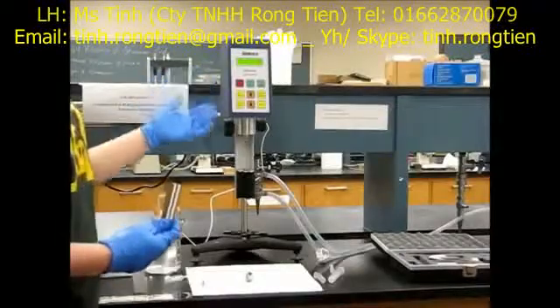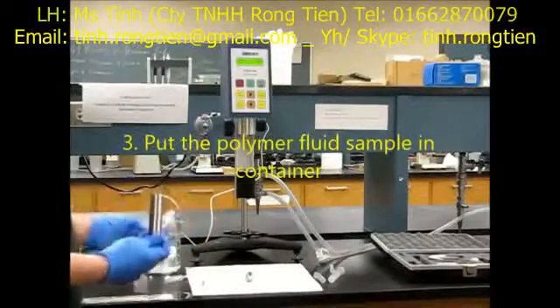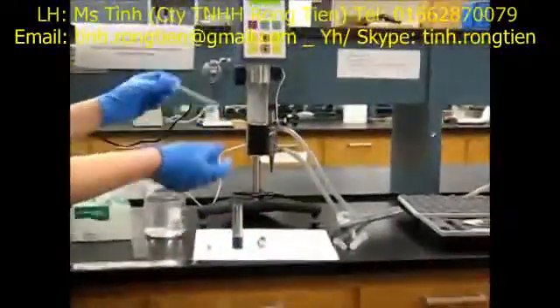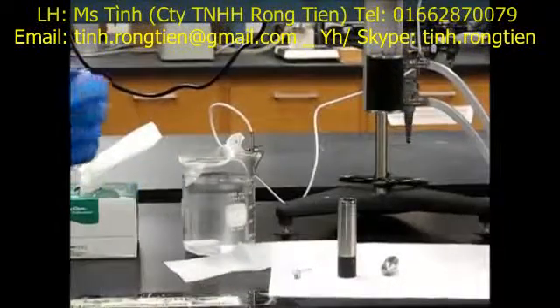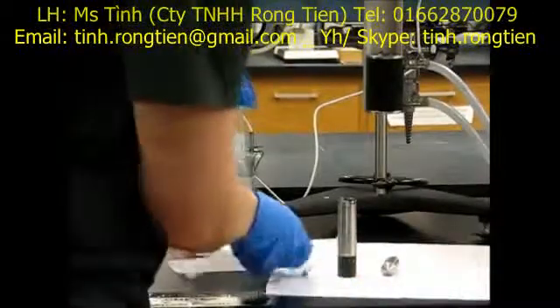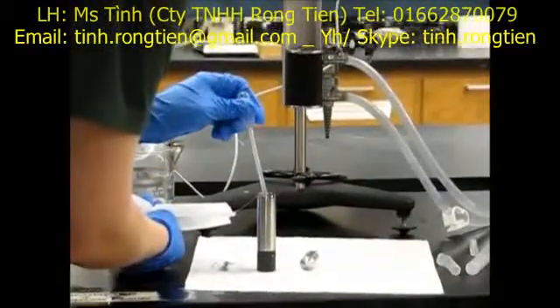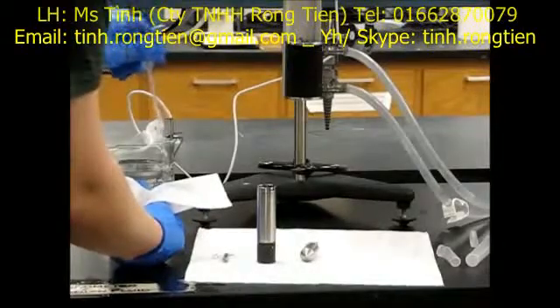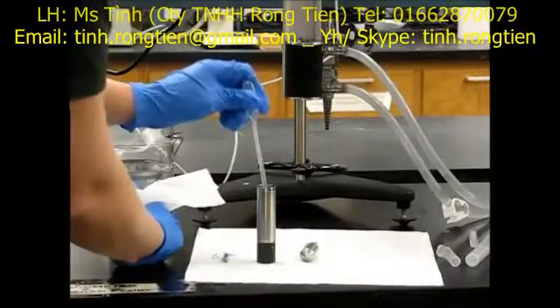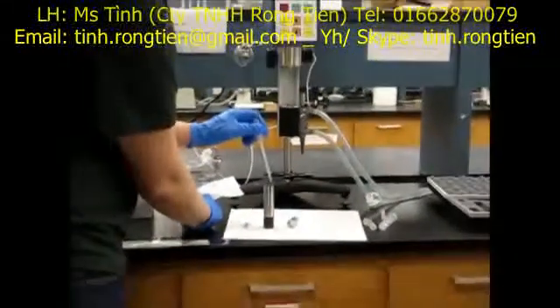Now it's telling us to replace the spindle, but before we can do that, we need to fill our sample container around 25 percent full with our polymer solution. It's going to take about three squeezes to get to 25 percent. Be careful because this fluid is very viscous and it will make a mess. We want to make sure the container is only around 25 percent full so that we have enough fluid to completely cover the spindle once it's in the container, and so it doesn't overflow when we put the spindle in.